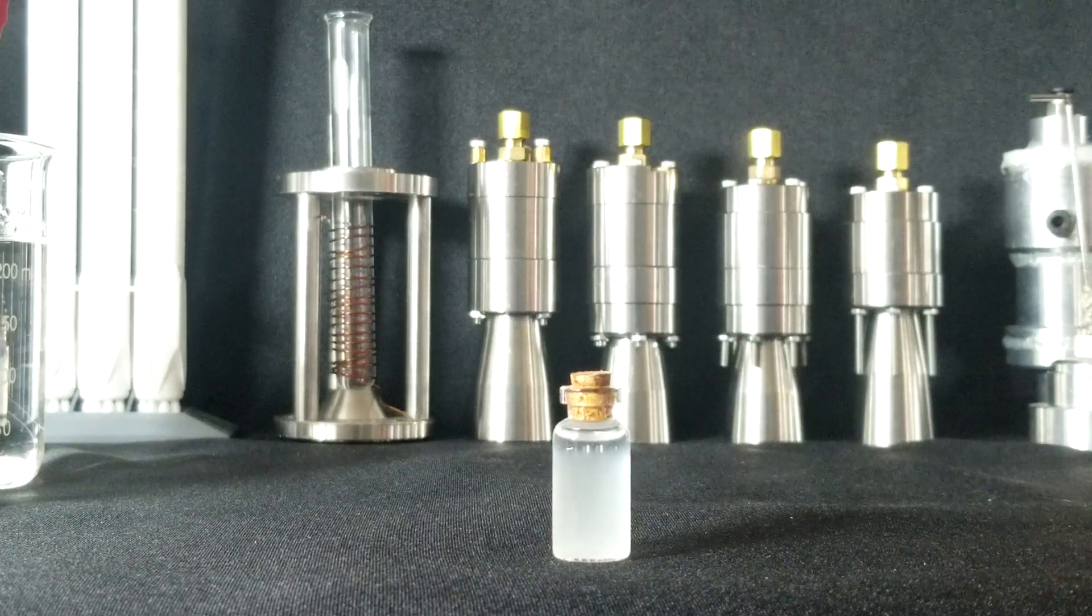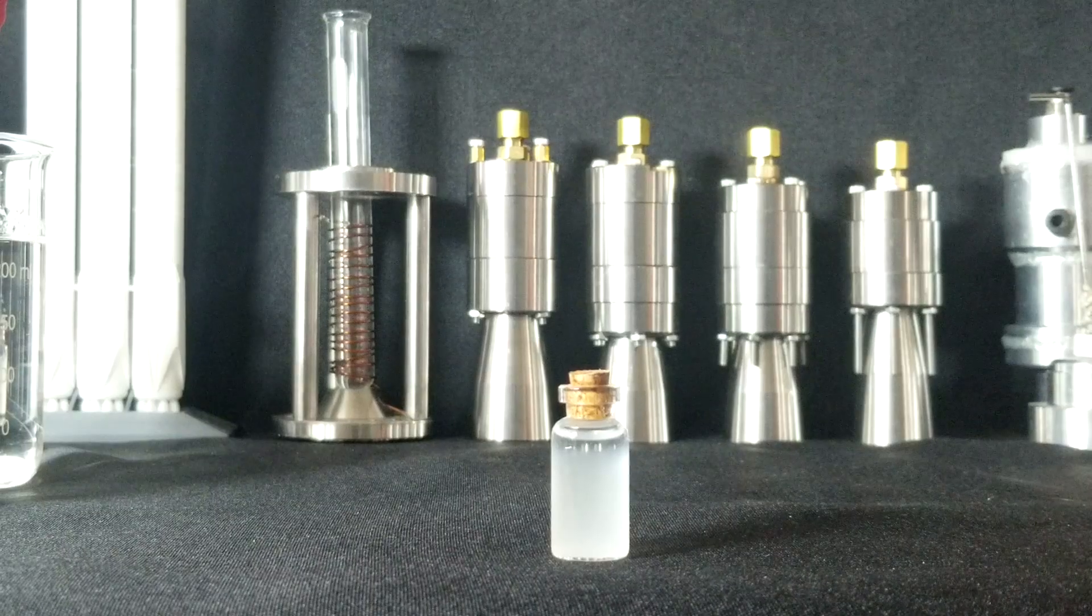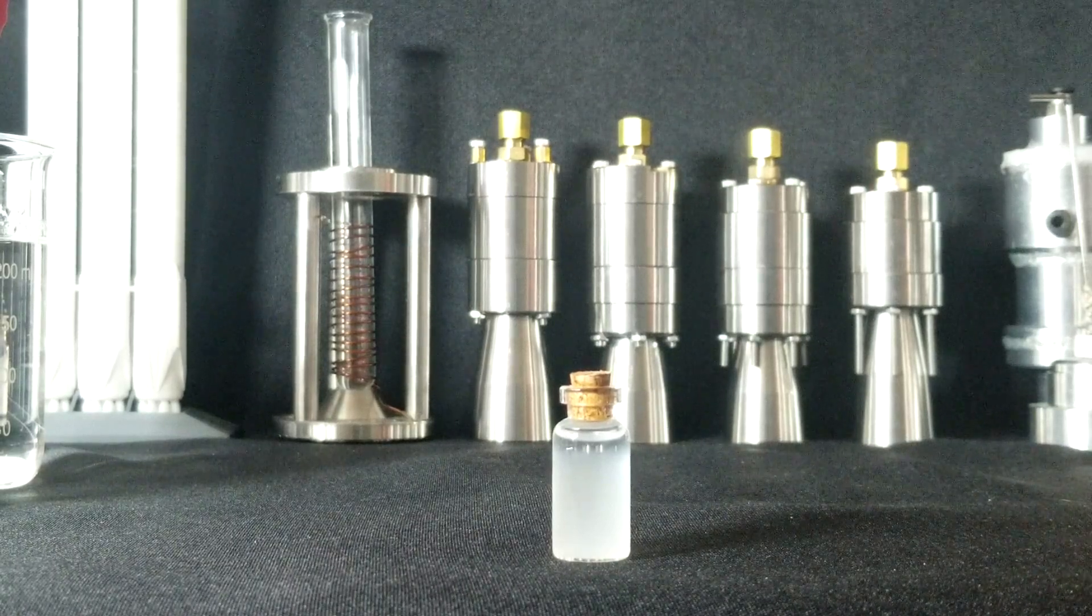This is the final product, and the mass is about 3.8 grams, so the yield is only 6.3%. Now we can see why the essential oil is so expensive. The quantity of oil extracted for a given amount of lemon is low.